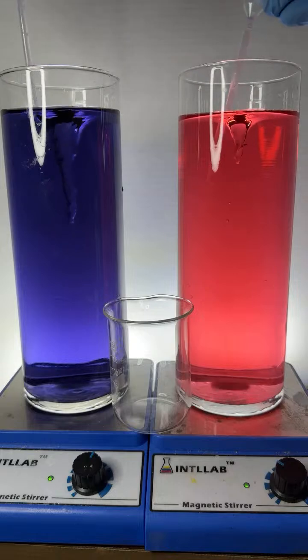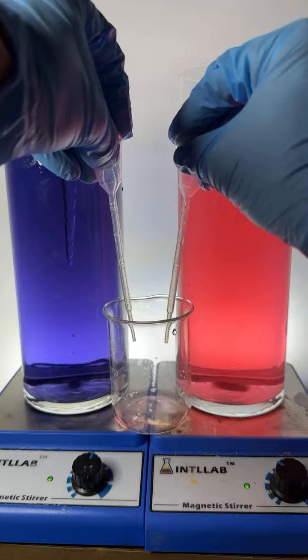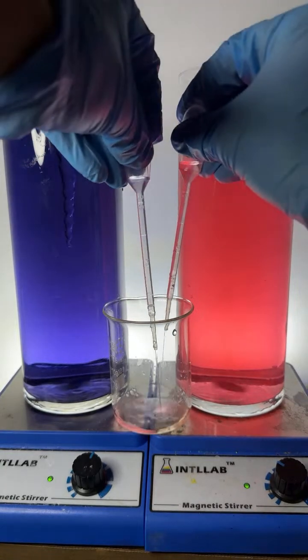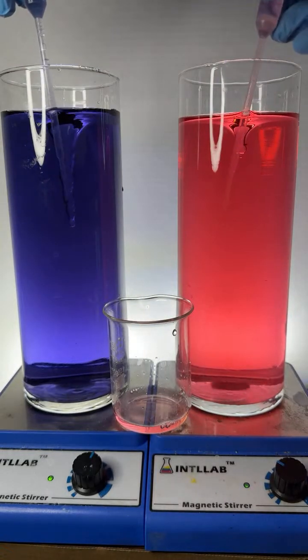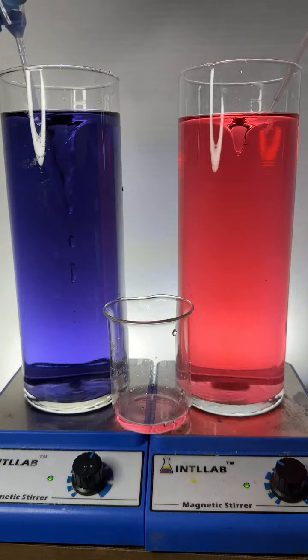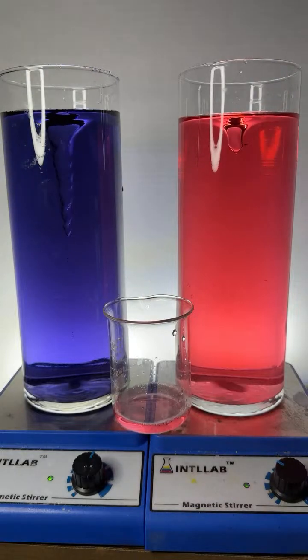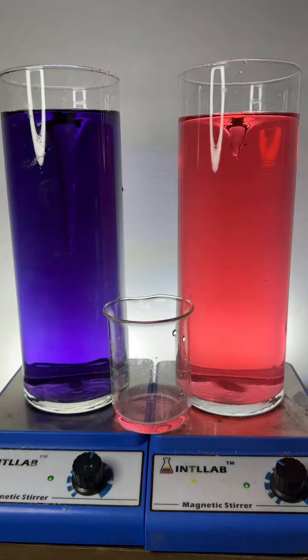All right, here we go. A little bit of both. A little bit of red, a little bit of violet. Let's squirt them in the same container. Looks like my acid is just a little bit more concentrated, so I'm going to squirt a few more squirts of base. Actually, I want to make this just a bit more basic. Yeah, let's do that. Let's see how that works.